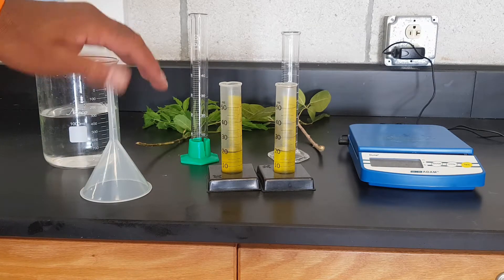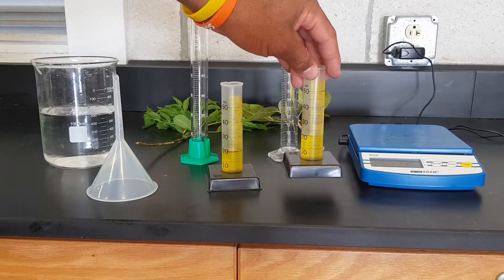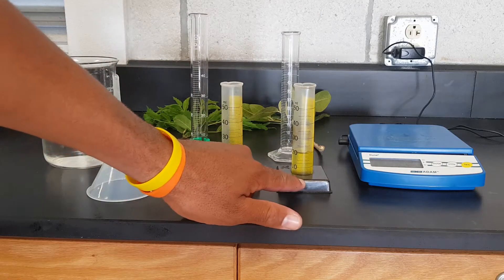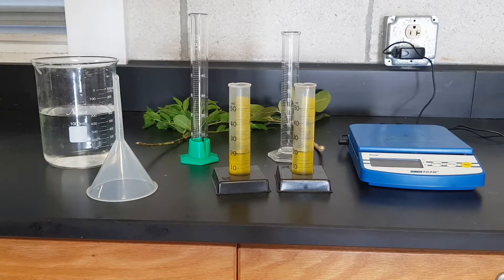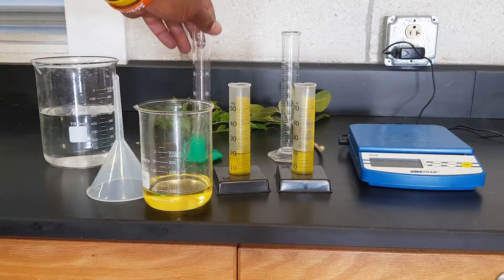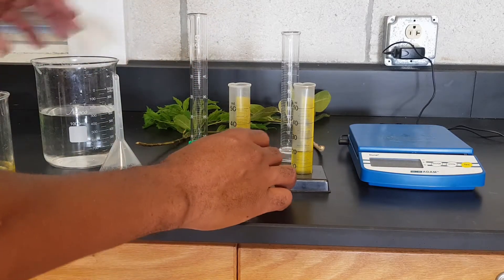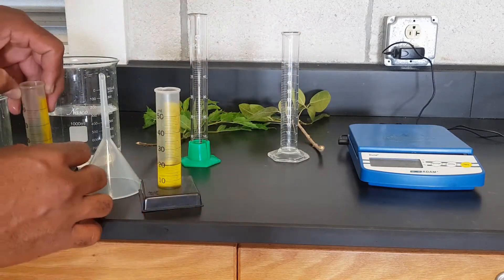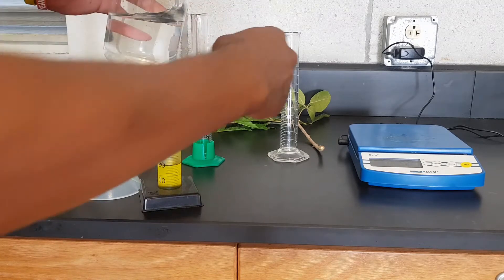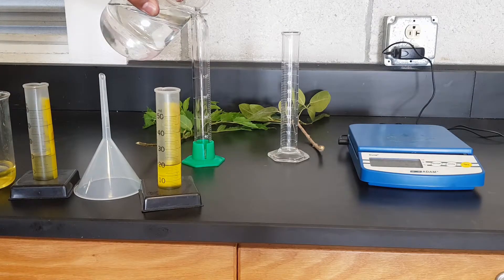I have a beaker, a funnel, and measuring cylinders. I have measuring cylinders with oil — I already measured the oil. We are also using measuring cylinders. The first step I'm going to do here is to pour in some water, and I want to keep the same volume of water for each measuring cylinder.